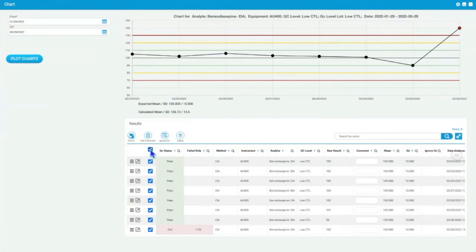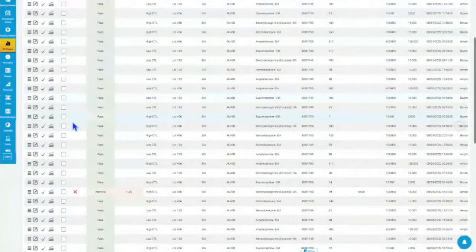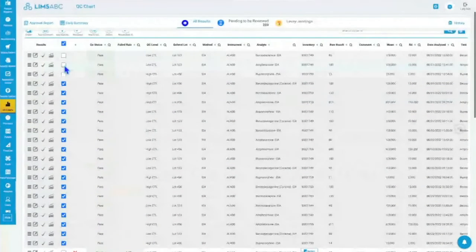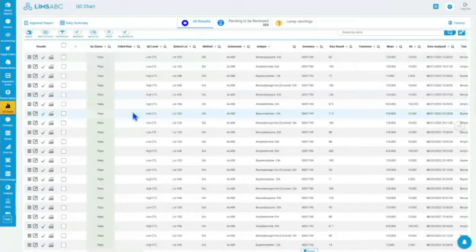You can add comments in batch. So if you have multiple that failed that you want to add comments, or you just want to add the comments to all of the QCs for that day, you can easily just select them and do an add comment. So this is more of a day-to-day, batch by batch or instrument by instrument. QCs came in, you've looked at them, they passed, they failed, you select them, and you say that you've reviewed. So this helps with the monthly review, let's say, that you have to do if you check them daily, and obviously you make sure everything has passed and you've reviewed, and you have no surprises at the end of the month.